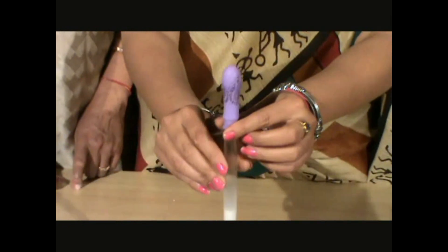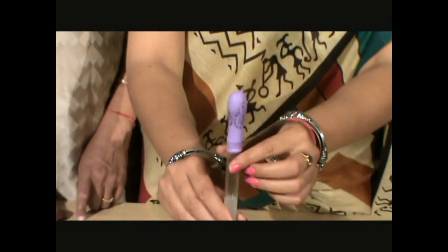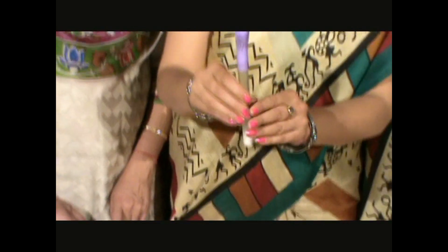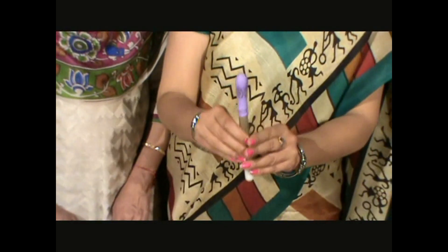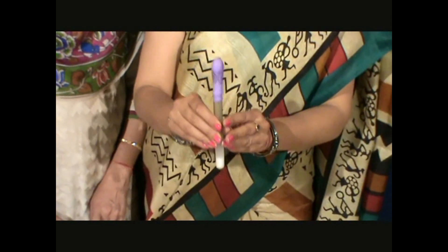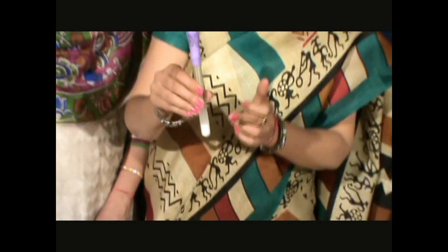But in test tube A we can see that the balloon has started inflating. This inflation is due to the gas being produced in test tube A — carbon dioxide — because when yeast acts on sugar, a gas is produced. This gas has no space to escape, so it enters the balloon and causes it to inflate.